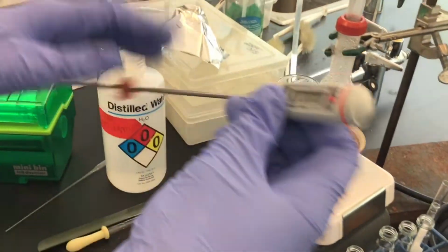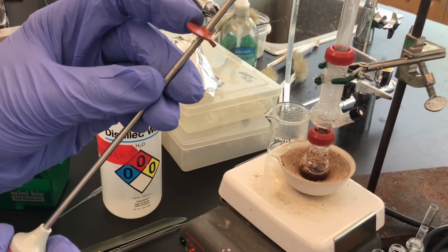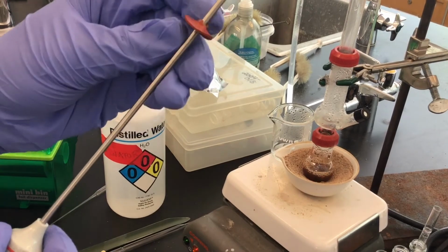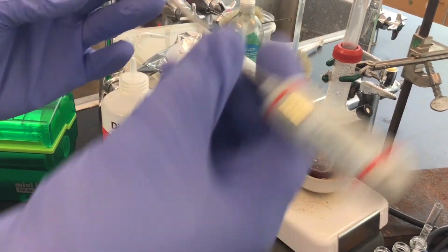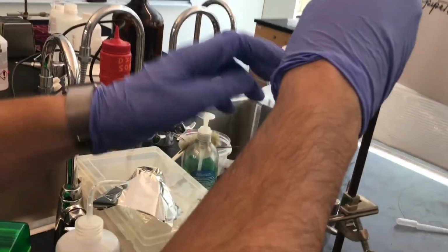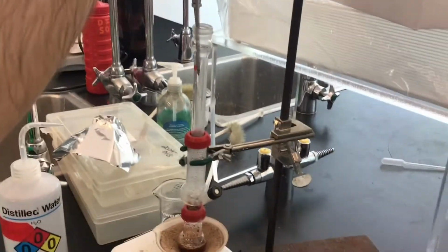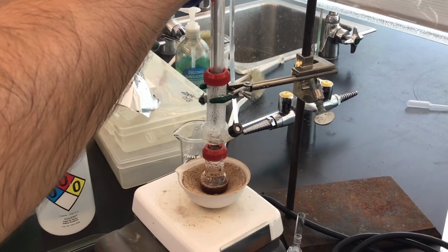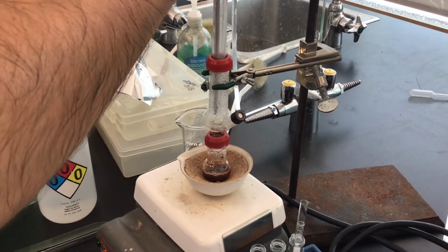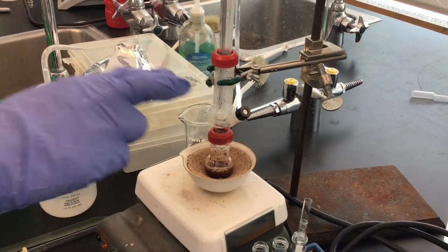So I've got my digital thermometer, and what I've done is I've pierced it through a microscale septum, just made out of basic rubber, so that way it can hang out here and not fall all the way down. So right now it's 22.9 degrees in here, and I'm going to dive down, and once again, I'm just going to try to get in that area of the still head to record the temperature at which the vapors are condensing.